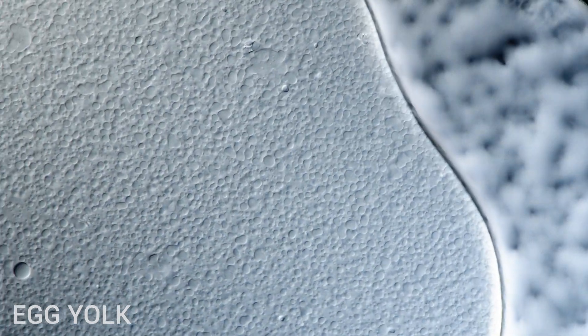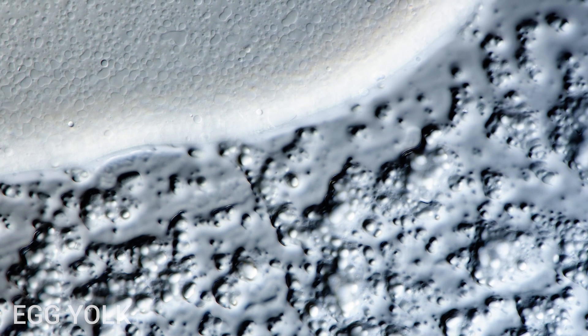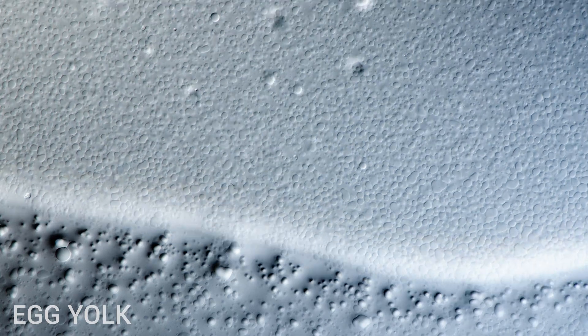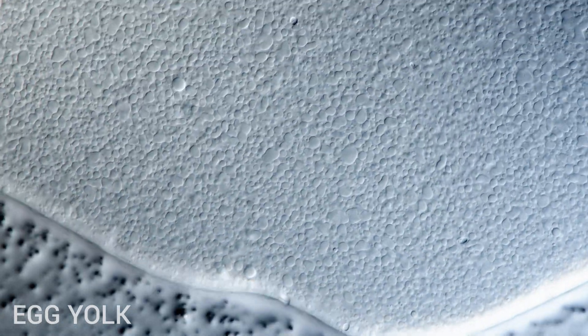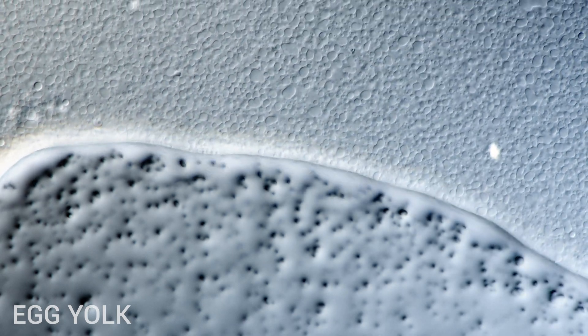Yolks, particularly from free-range eggs, can have a wide range of colors, spanning from nearly white to practically red or even olive green, depending on the pigments in the hen's diet. Feeding hens large amounts of red pigmented food, such as peppers, tends to result in red or deep orange yolks. Commercially, chicken farms can use additives to produce darker yolks, even though their hens never leave the building.